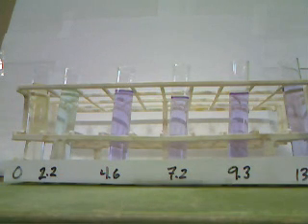And so there is the color of crystal violet in each of our 6 solutions.